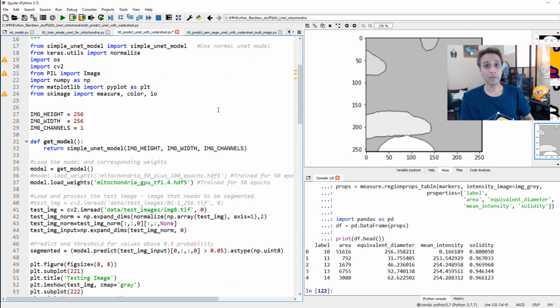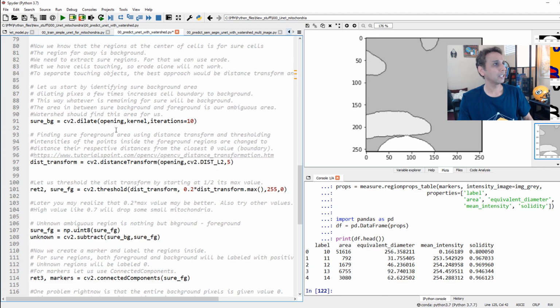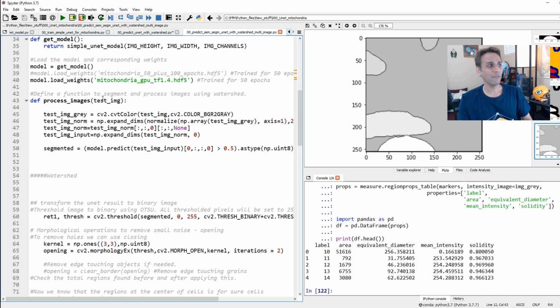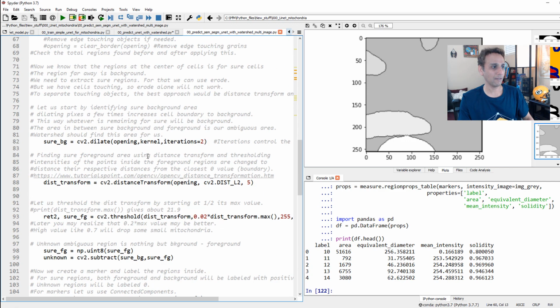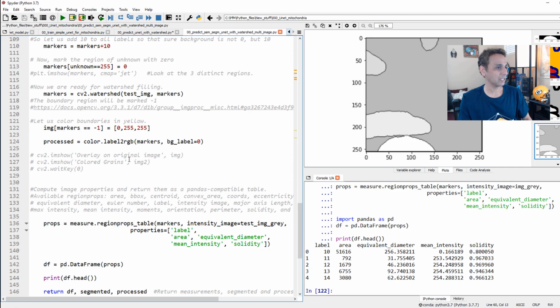I hope you appreciate the lengths I go to make sure you don't waste your time doing things that I've already done. Please do something more and share it with others. Is this the one? No, sorry. Here, I put everything into a function and I called it process images. Exactly the same: we read the image, we segment the image, and then we threshold this image, all the operations we just did. You see, you do the distance transform right there, and you perform all of these actions.